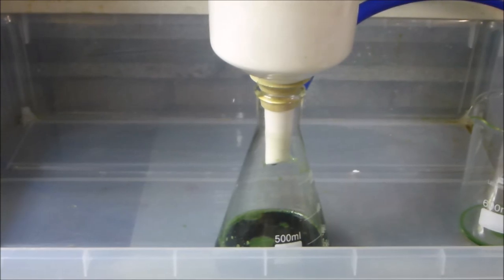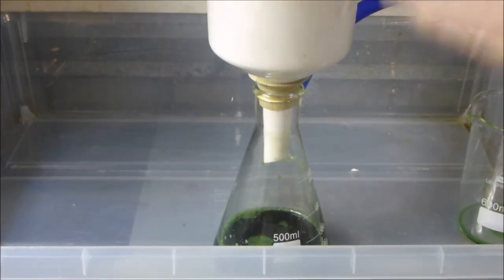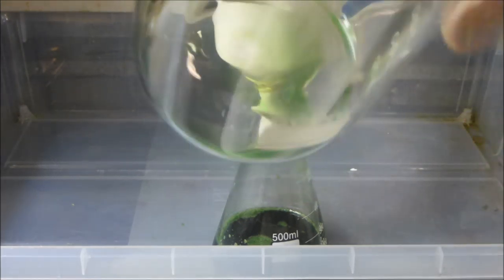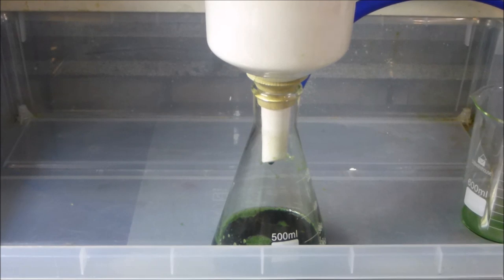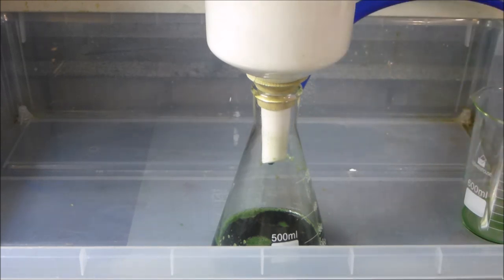It's definitely the first time I've ever used a single filter to filter this much AP, and it's coming out, like, this is the little thing that I put the filter in, but it's coming out absolutely crystal clear. It's kind of hard to demonstrate, but it's taking out the finest of particles while still being able to filter after having all that solution go through it.